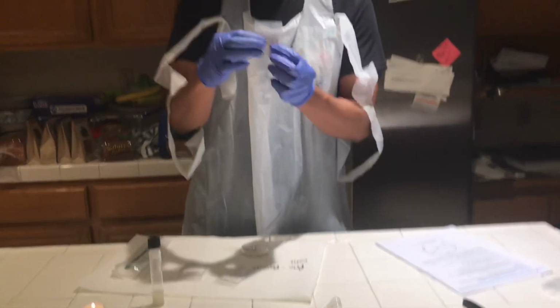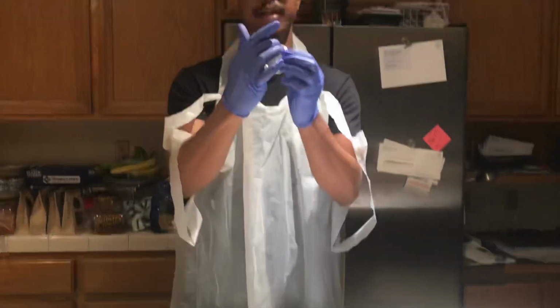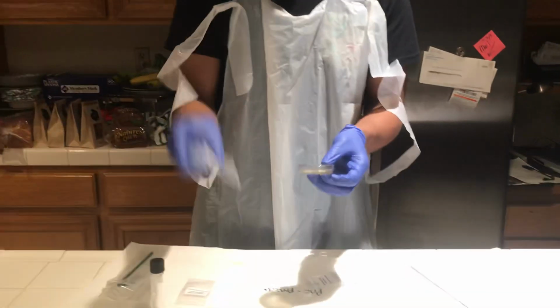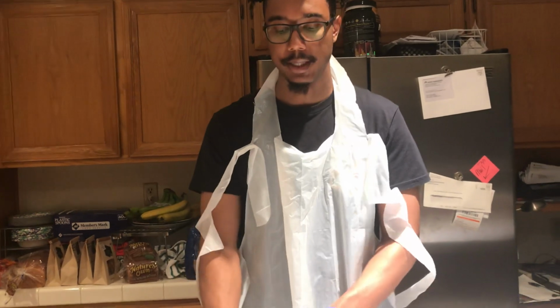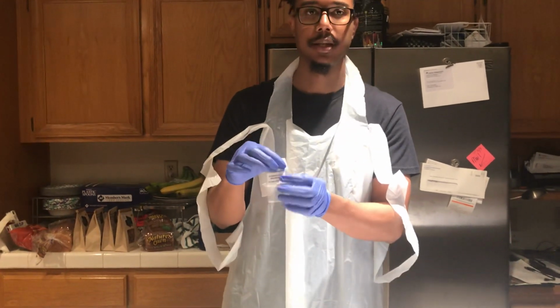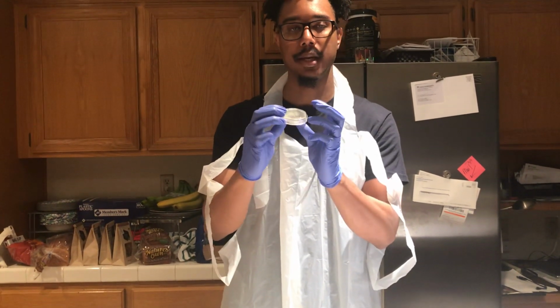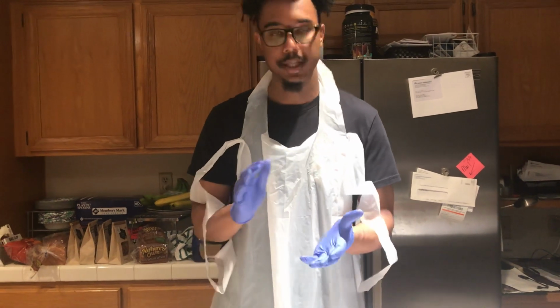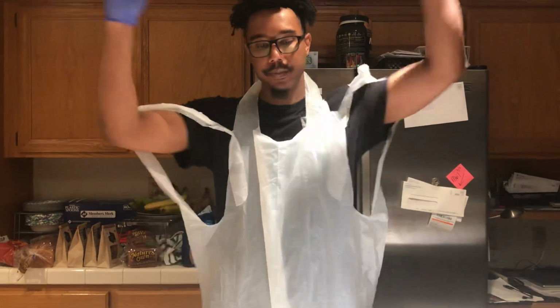I'm going to use my tweezers, and I'm going to take the discs labeled penicillin and put it in the penicillin spot of the agar plate with the broth already on there. And then I'm going to take the one labeled gentamicin, place it on the gentamicin and make sure it's firmly placed in there. Then I'm going to take the one labeled novobiocin and then place it in the novobiocin spot of the agar plate and make sure it's sitting in there nice and snug. And after they're sitting in there, it's going to sit for 12 hours and then come back and then see what happens. Alright, so let's go ahead and begin.